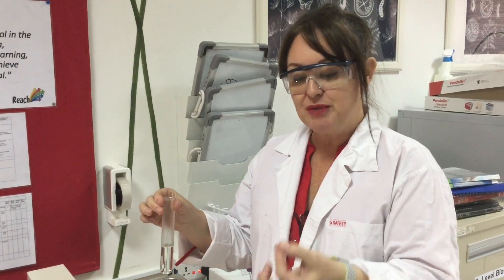I'm going to take this and place it in acid. If I'm around acid, I need to wear my safety glasses. One of the things you will have been asked to do is to research several methods of this procedure, because they each bring advantages and disadvantages. The one that AQA suggests uses five molar acid; this one uses one molar acid. Why would I have chosen this one? Why am I using acid? The acid is heated — why is it heated? What is it doing?